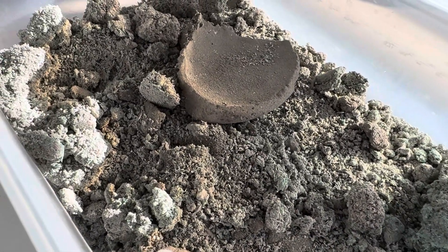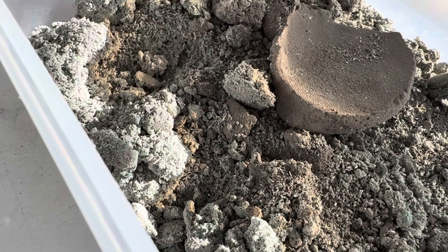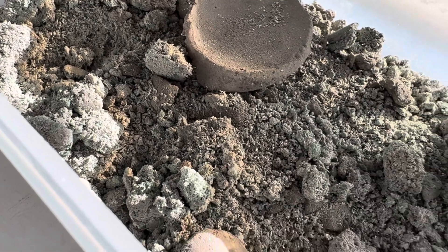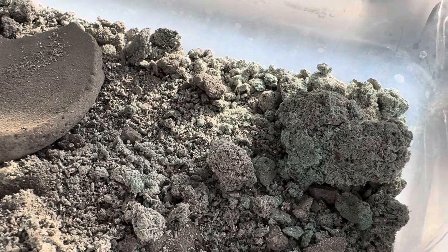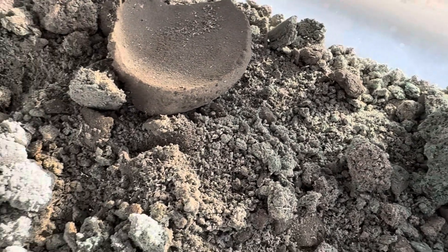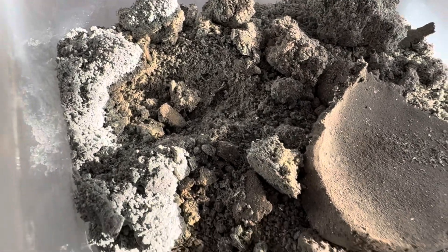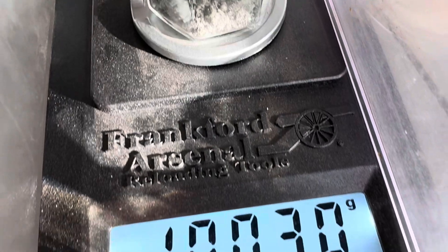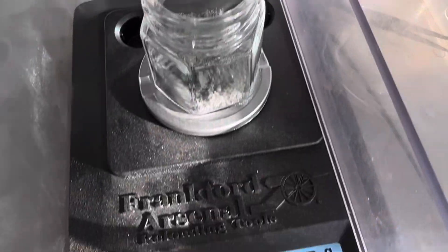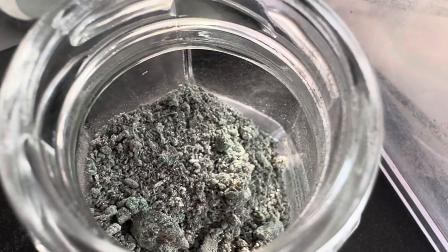We're taking a look at that cement silver. You can see a little blue hue to it — this is silver that's been collected and dropped out from our silver cell refining. We use copper to drop the silver out of the silver nitrate solution, so that's what we're looking at here. We're going to cupell 10 grams of this with a collector metal and 10 grams without. The second jar's weight is within range at 10.0 grams, and this one was 10.06, so we'll have them marked accordingly for a good analysis of the final result.